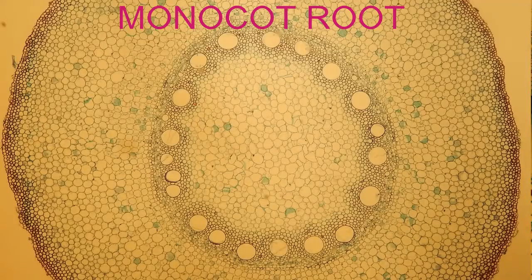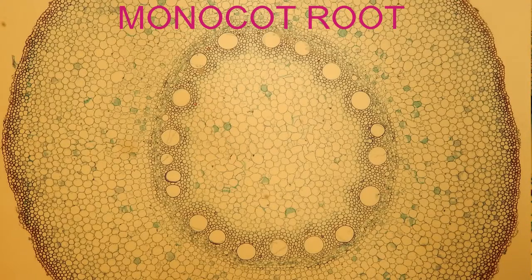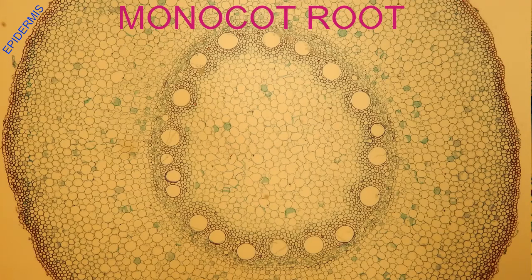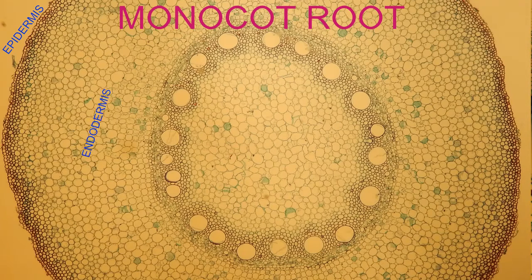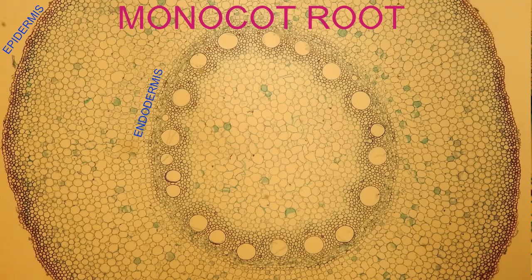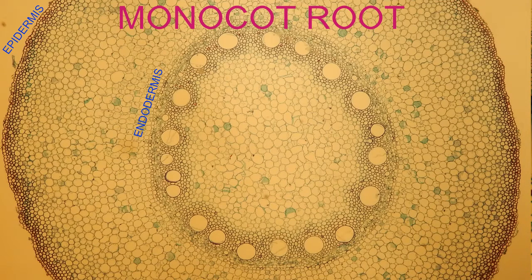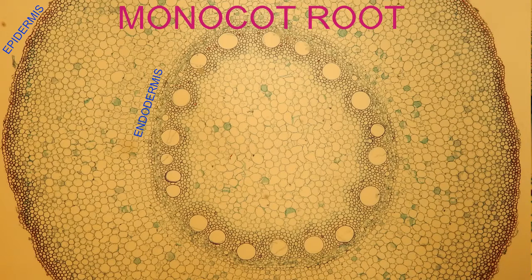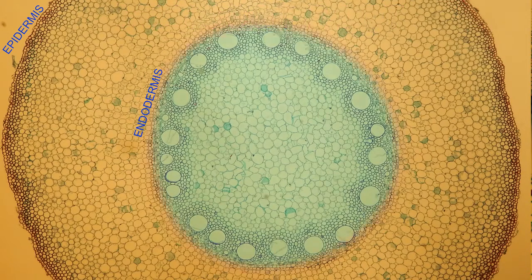This root section has an outer epidermis, and in the interior there is a single layer of cells known as the endodermis, which produces a waxy substance known as suberin, which is arranged in a formation known as Casparian strips and helps to control the flow of water.